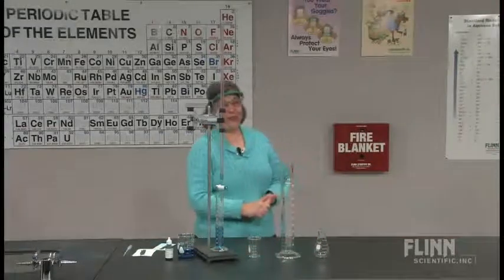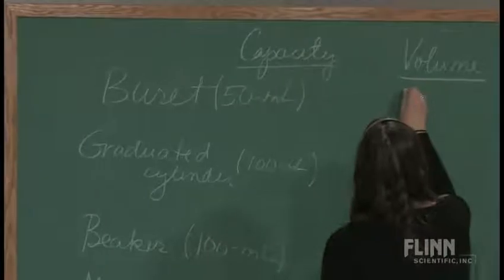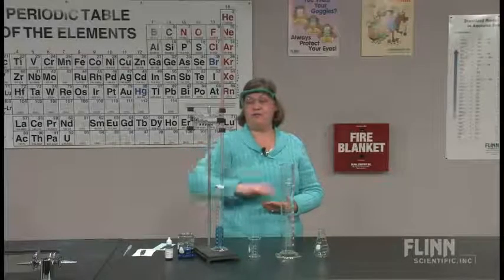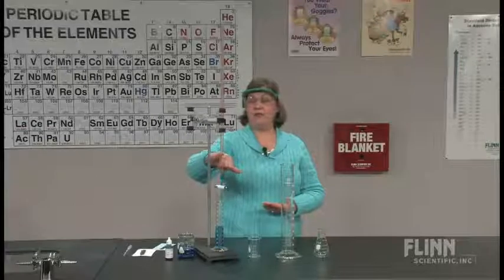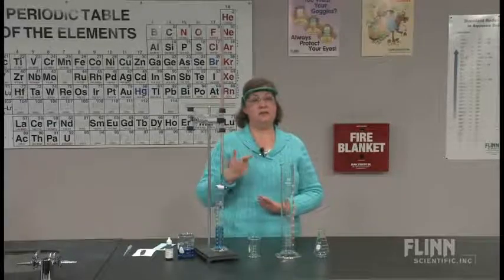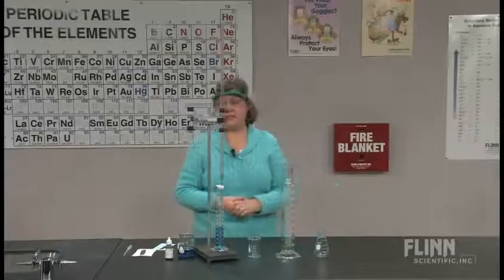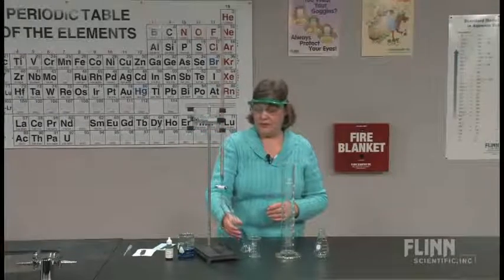We used a 50 milliliter burette, and I measured 50.00. So we're going to write 50.00 because on a burette, I've got major markings, 44, 45, 46, and so forth. But then I have minor markings at the 0.1 level. So I can see a line for 42.1, 42.2, 42.3, which means I need to estimate beyond the last minor marking on the glassware. So I'm estimating, obviously, the second decimal place there, the 100th of a milliliter. So that was 50, and I'm going to take that out from under there.